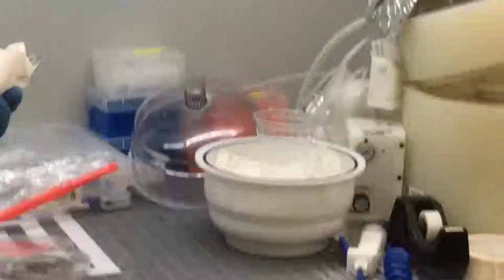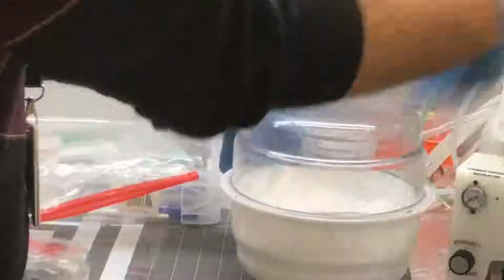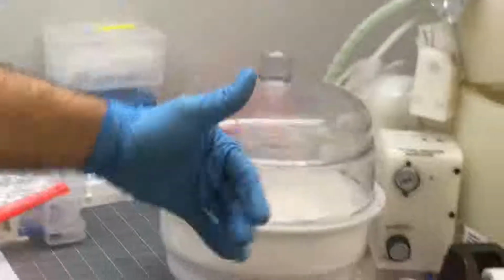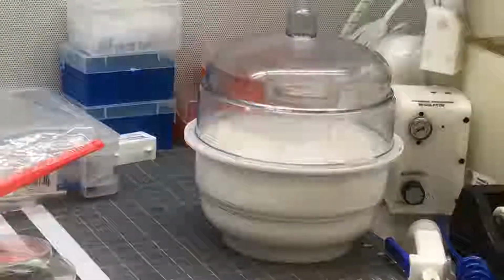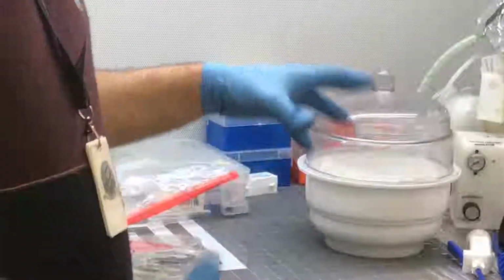The timing of the vacuum depends on 3 factors. First one is the pump force. It's written on the pump how much force it has. So you are using a desiccator, in fact. This is the desiccator, but since we attach it to the pump, it works as a vacuum. You just put the cap on the top. Exactly. So 3 things are important for the timing of the vacuum, to know how long it takes until all the air is gone. The first is the force of the pump. The second is the amount of PDMS and curing agent. When you add more, more time is needed to remove all the air. And the third is how much air goes inside during the mixing. I see.